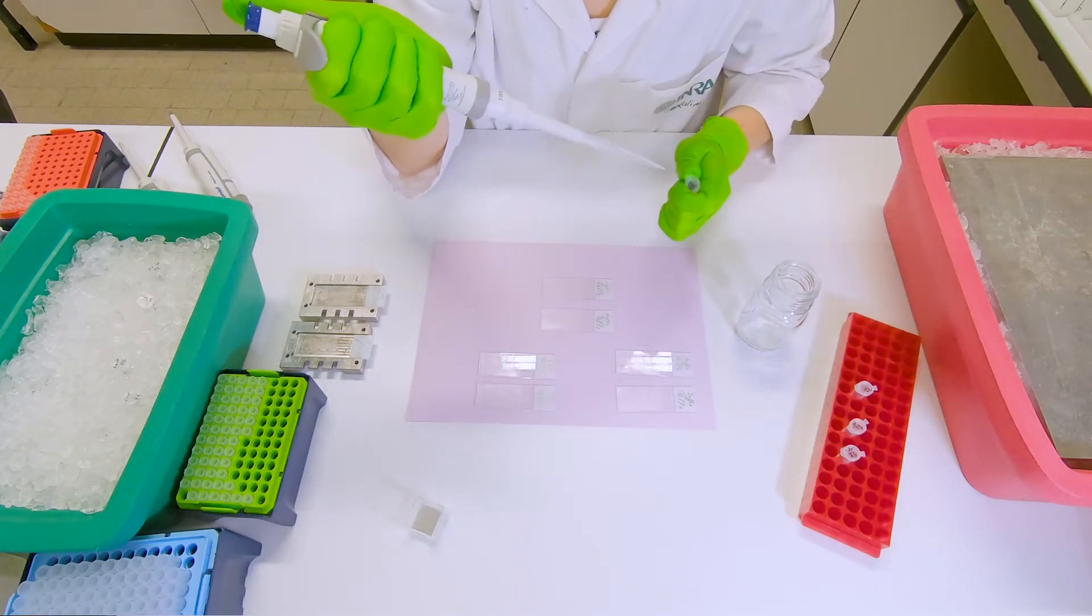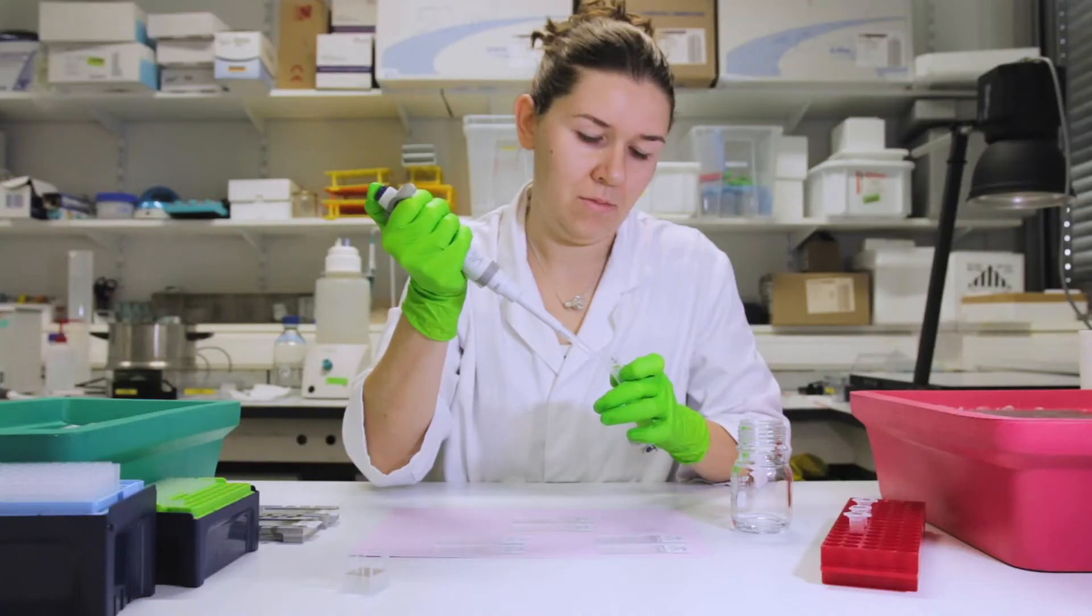Mix the cells with 1% agarose to a final concentration of 0.7%.